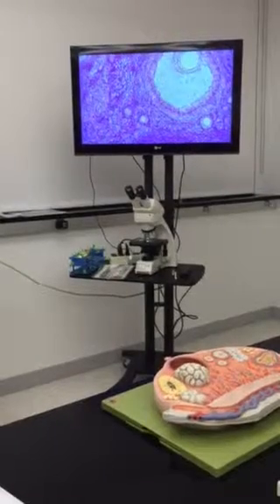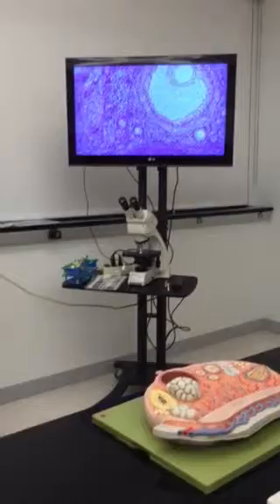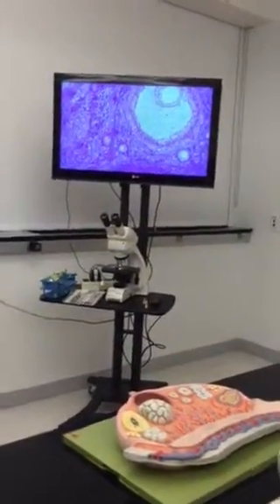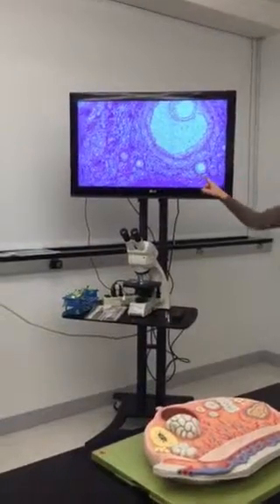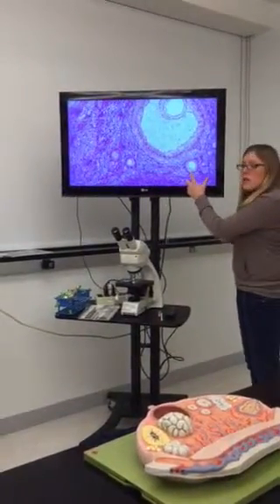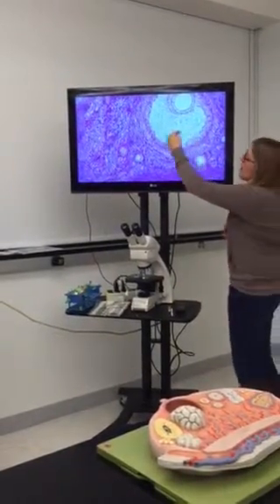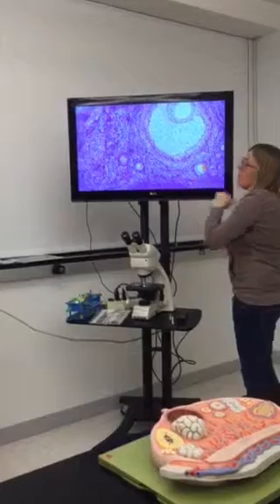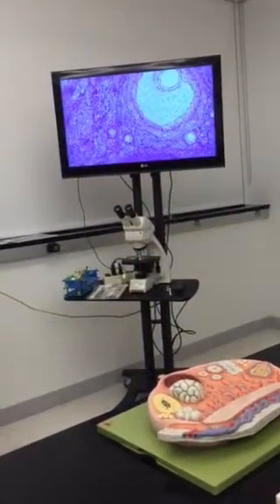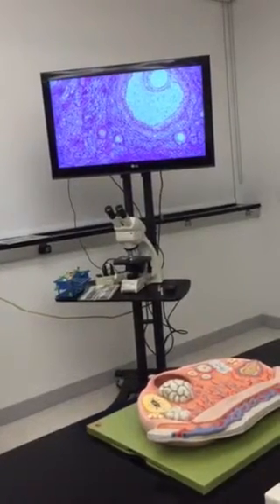Now, what do you look for in a secondary, which is the next stage? Didn't you say it was like antrum coming from both areas, like on the top and the bottom? It's going to be larger than the primary, of course. You're going to start to see breaks in the simple cuboidal layers, fluid-filled spaces. So you're not going to see a big one like this, but you're going to see one or more spaces start to form between the cuboidal cells. That is a secondary follicle.